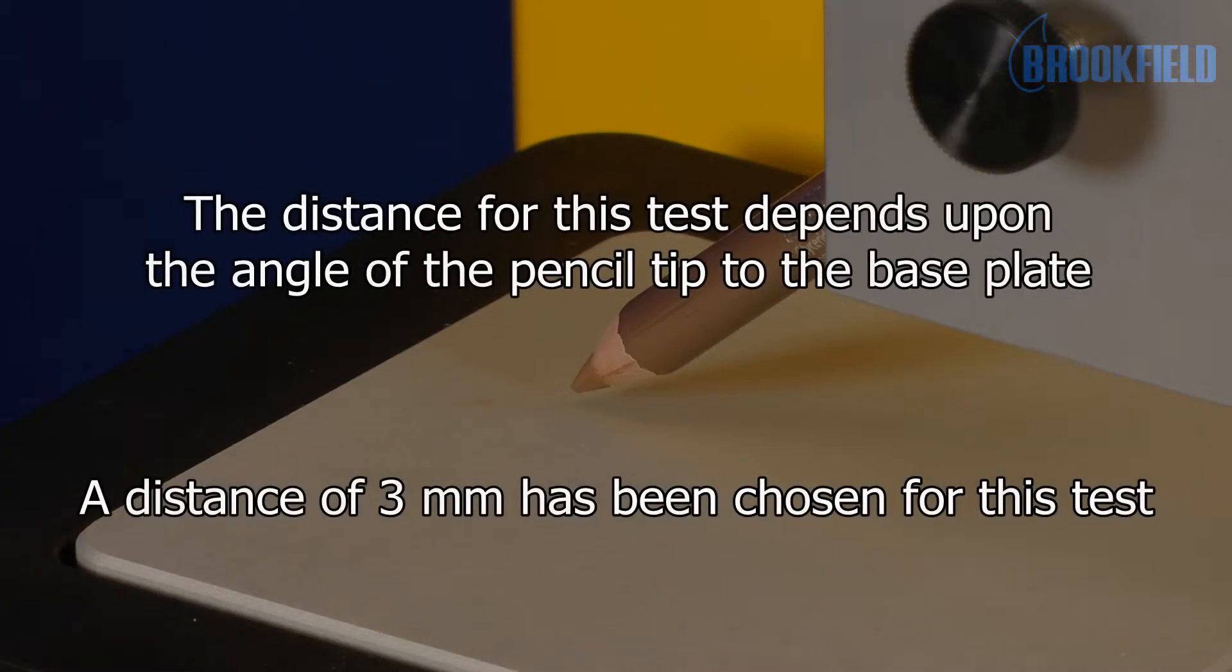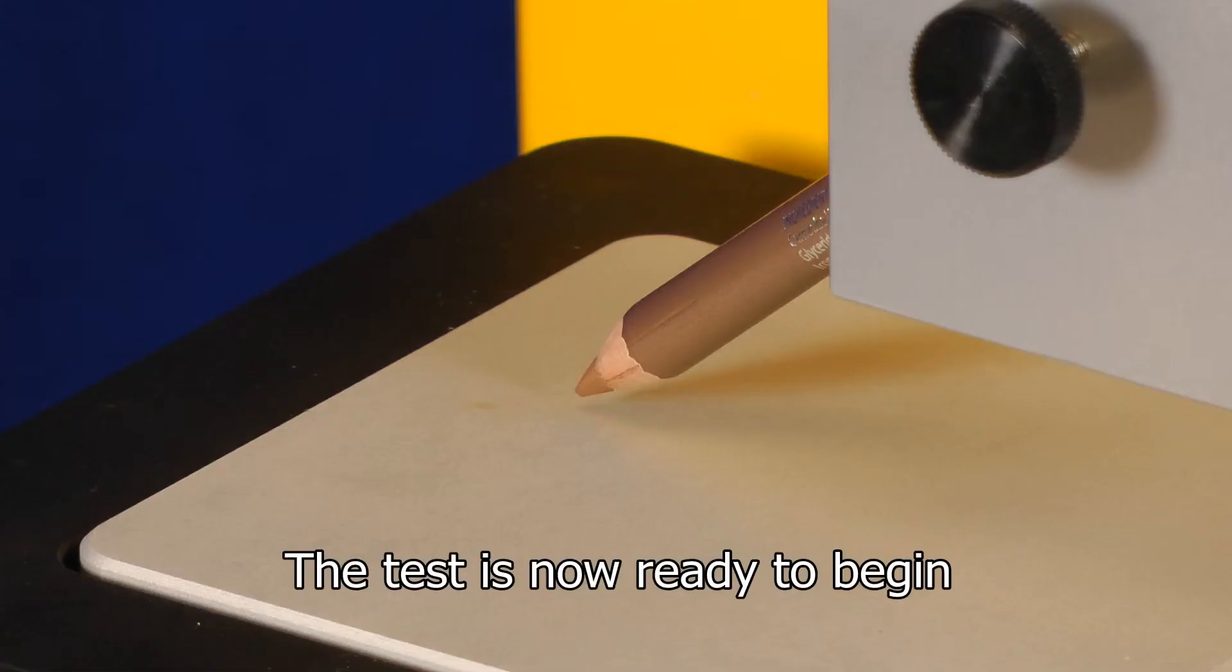The target distance for this test depends upon the angle of the pencil tip to the base plate. A distance of 3 mm has been chosen for this test. The test is now ready to begin.